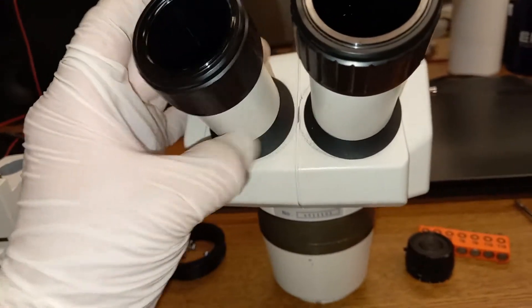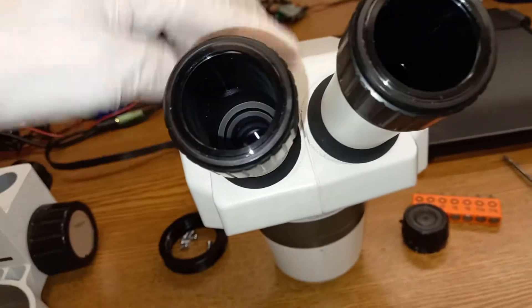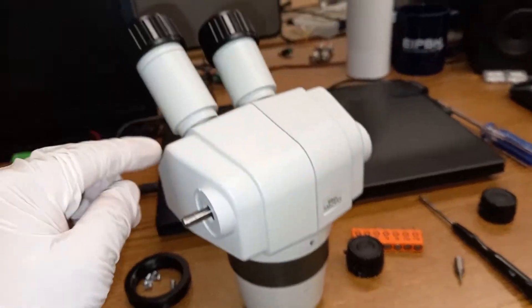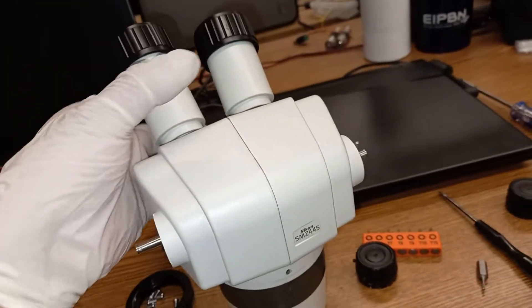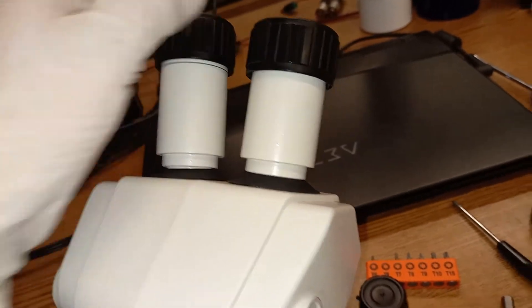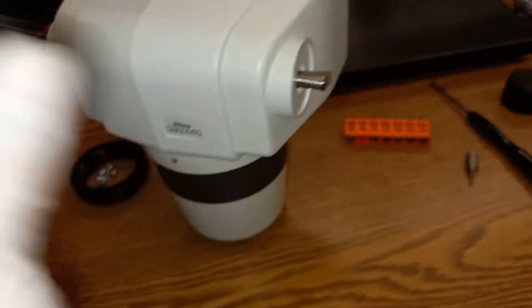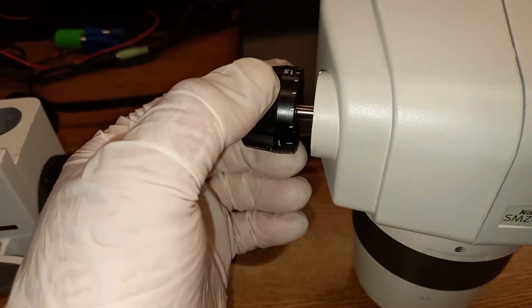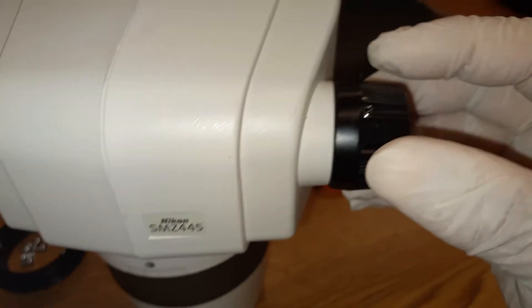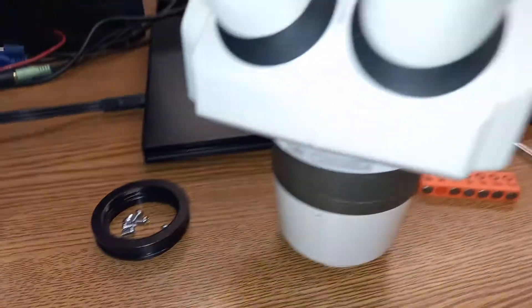Now both sides are on and the housing is together. I attached them together, clipped them, and attached these lens housings here. Next I need to attach the knobs and then after that I will place this collar on. I got the small screws in there and placed this on top. I've tightened the screws on the adjustment knobs left and right, which are connected by a single shaft. Now the only thing I need to do is screw this collar back into place, because this is basically a collar that you can attach a fiber optic light on.